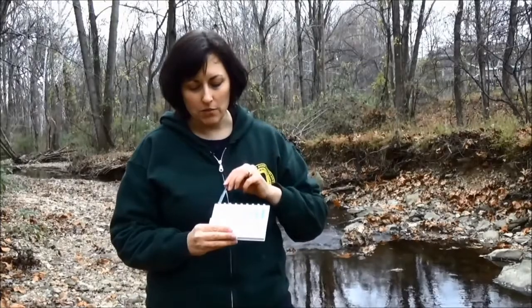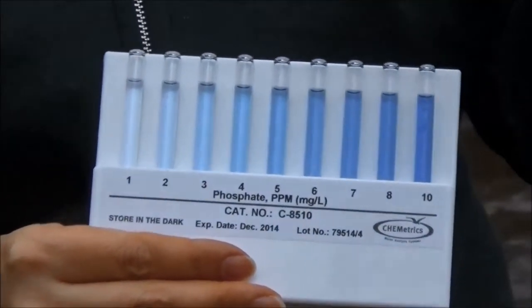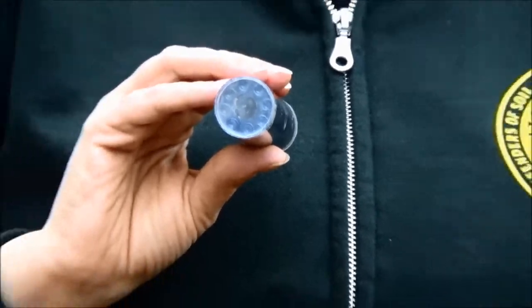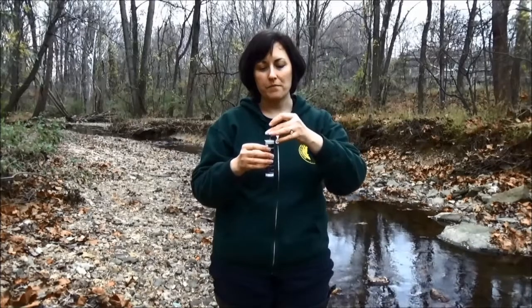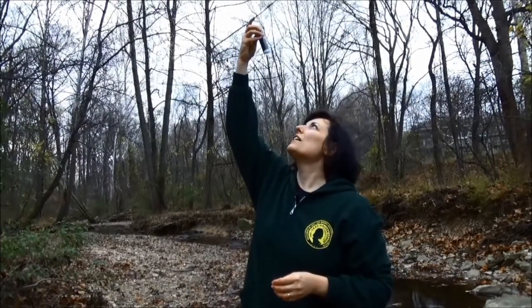If you have a lot of phosphate in your stream the color change will be dramatic enough that you can use the standard color comparator. But as you can see, the comparison with our ampoule is very clear, so we actually have another comparator we're going to use. This is our low-range phosphate color comparator that we use for phosphate readings below 1 part per million. On the bottom there are several ampoules with different colors that you can use to match your ampoule — you put it in with the pointy end up and hold it up to look from underneath to get your color comparison.